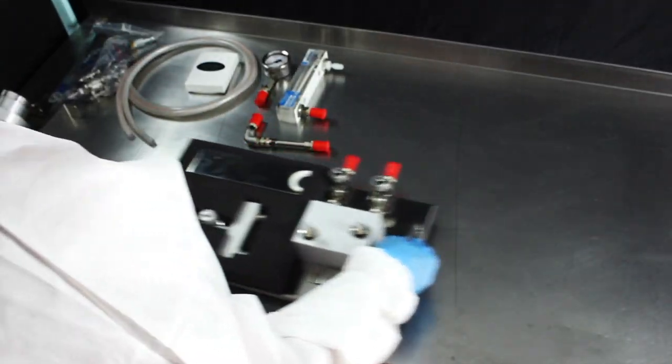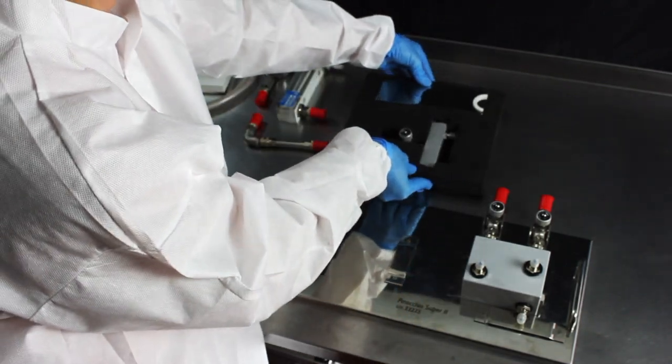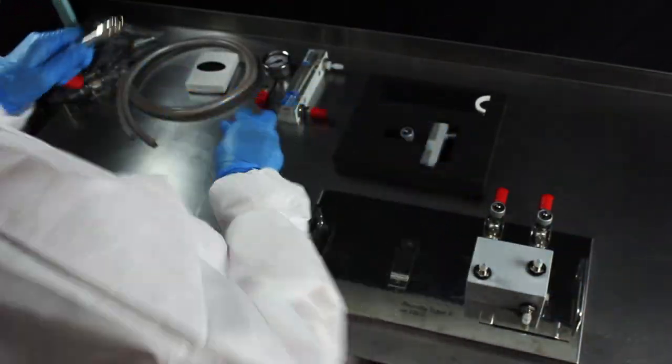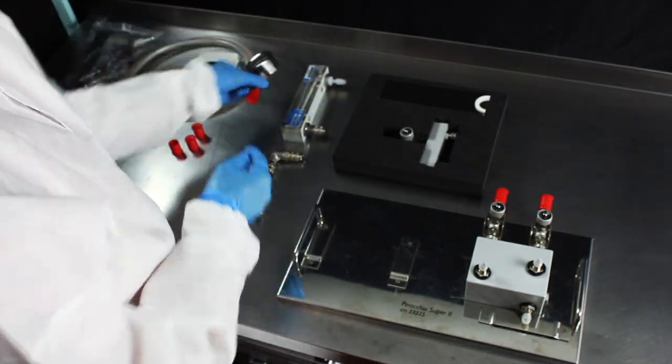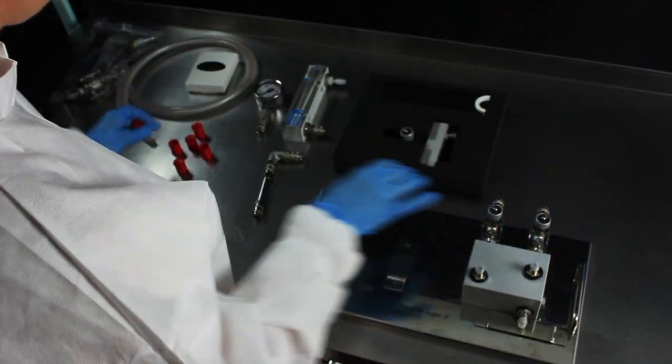Using your kit diagram and instructions as a visual guide, start by positioning the stainless steel base labeled A in front of you. Remove all protective caps from the Pinocchio parts prior to operating the equipment.